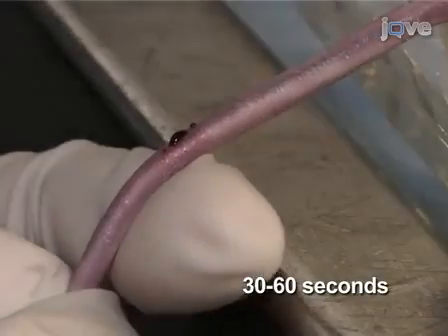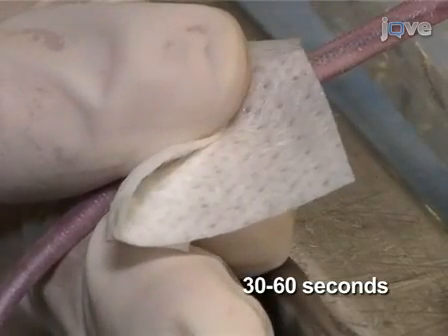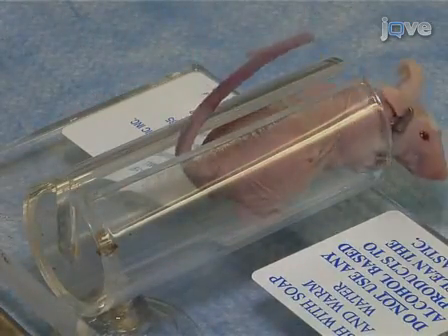After the injection, apply gentle pressure to the injection site until the bleeding stops. This normally takes 30 to 60 seconds. Monitor the mouse for 5 to 10 minutes to ensure that there is no further bleeding.